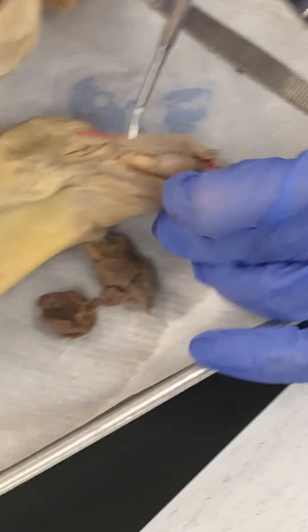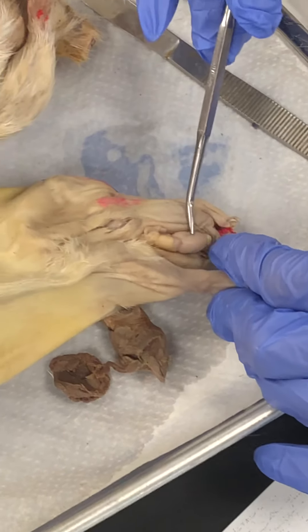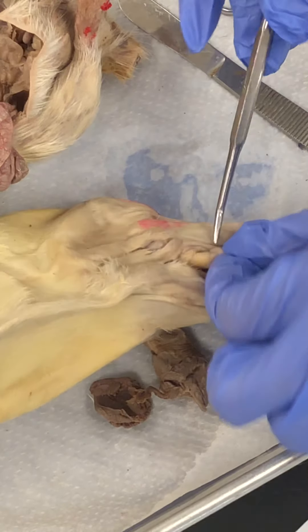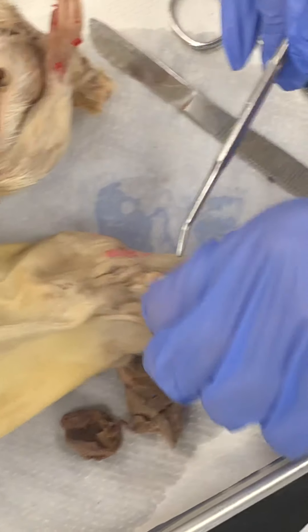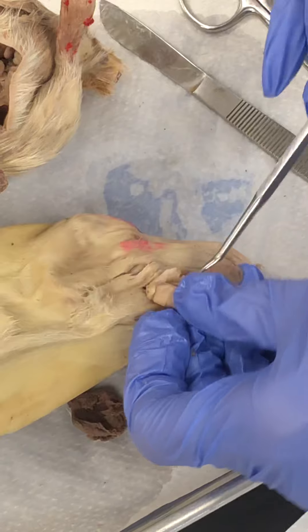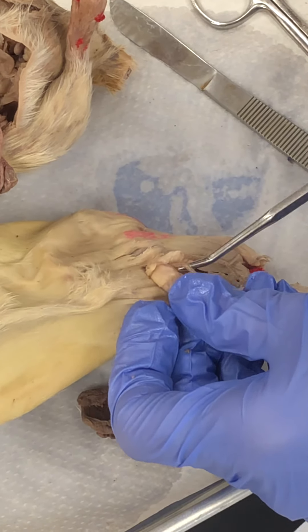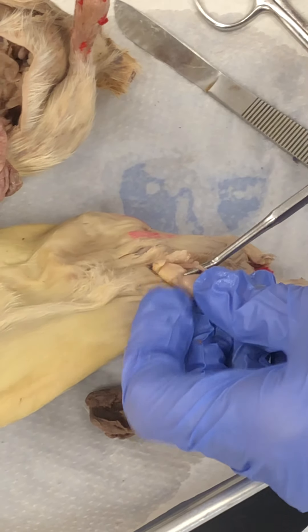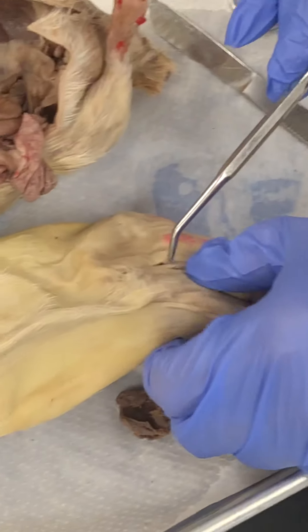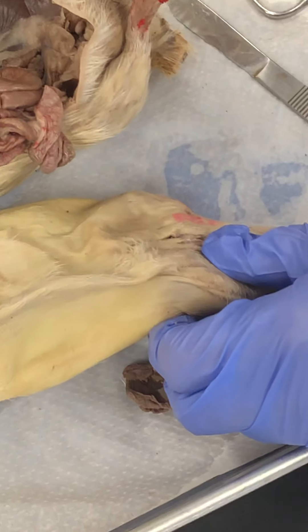Now we look at the male. This is the testis. The tube on the back right here — that's the vas deferens. This is the penis and that's the scrotum.